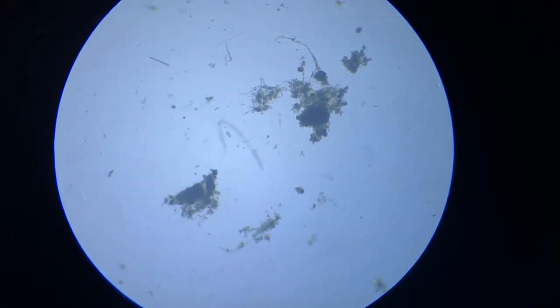If you're thinking this it is, then let me tell you it is something else. It's just a filament of something else. You see, it's not that worm.